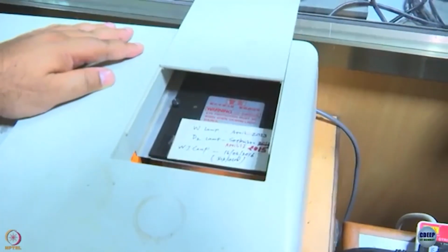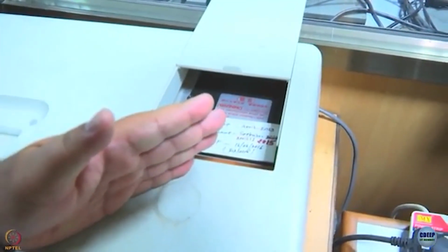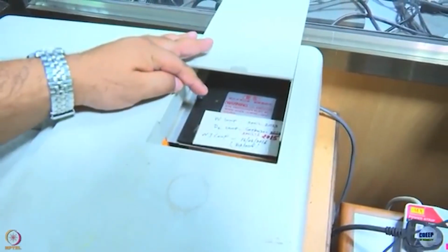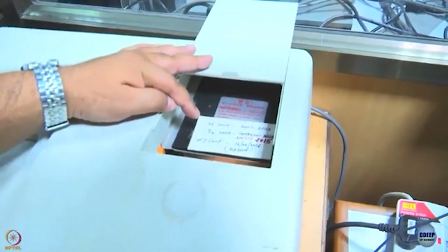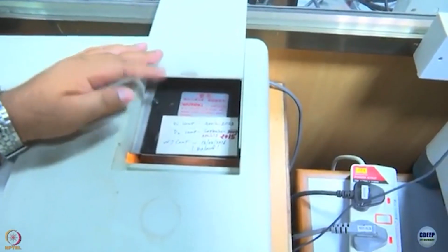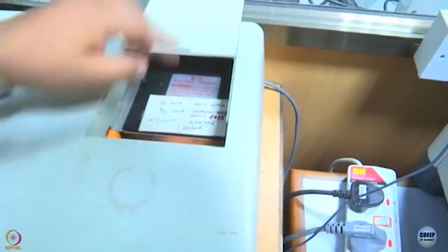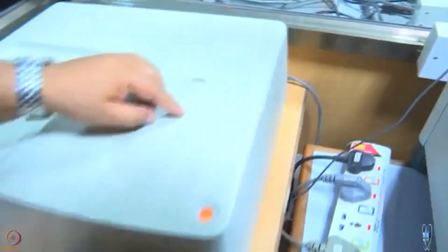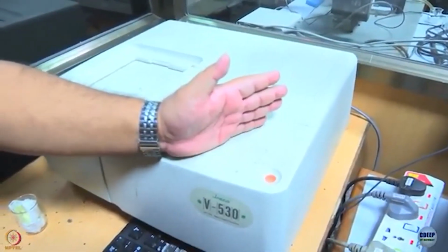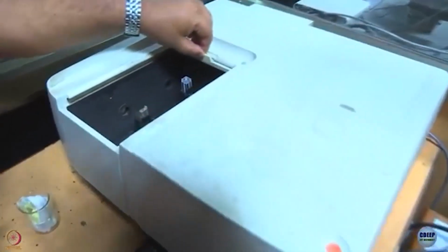But then we have to combine the outputs of the lamps. That is done by using a flipping mirror, which when we work in the visible range reflects the output of the tungsten lamp and cuts out the output of the deuterium lamp, and when we work in the ultraviolet wavelength it does exactly the opposite by swinging to a different position. So, the light from the lamp comes out, goes through a monochromator, so the color gets selected, then there is a beam splitter which splits it into two.